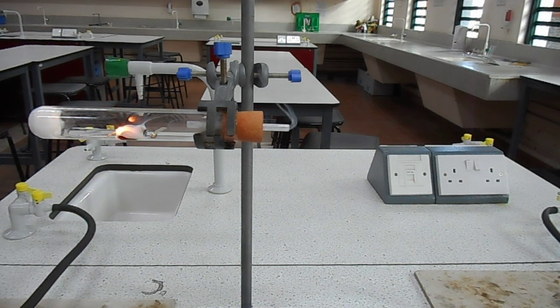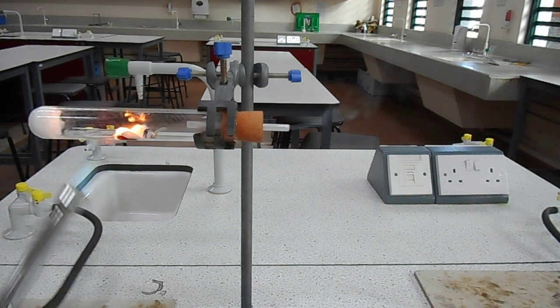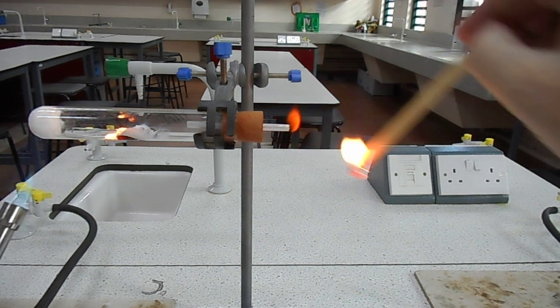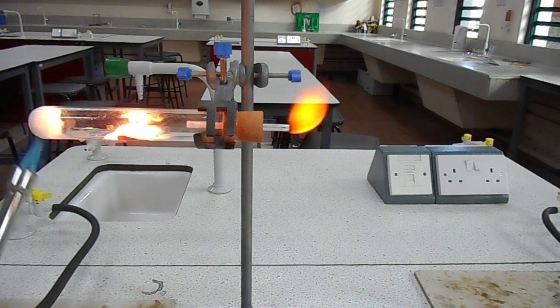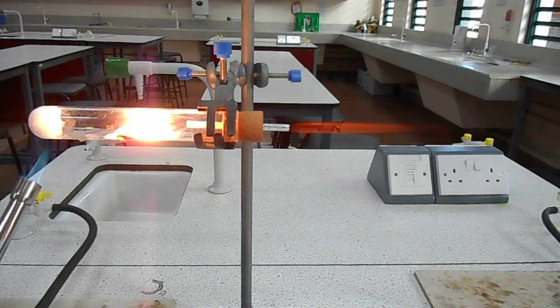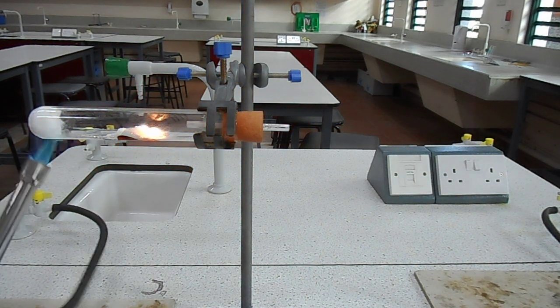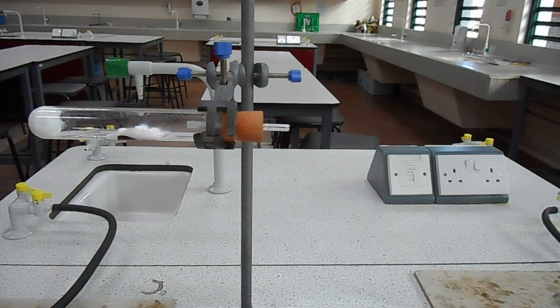And there you can see the reaction starting. And every time we pour the water we get steam. Also we can light the gas on the right-hand side which you should be able to see now proving again that we are producing hydrogen gas. So that's the reaction of magnesium with steam.